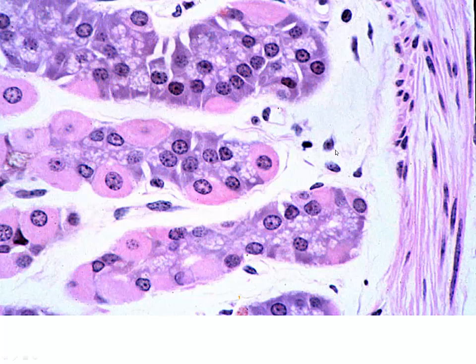Now, as we get down toward the base, once again, we're coming down in this direction. We can see parietal cells, nice large rounded cells. We have these vesiculated cells. These are going to be our chief cells, our zymogenic cells. Remember, we also call parietals oxyntic cells. And these are going to be the cells that comprise much of what we see in the base of our gastric glands.